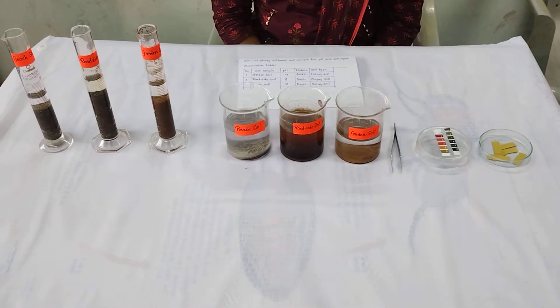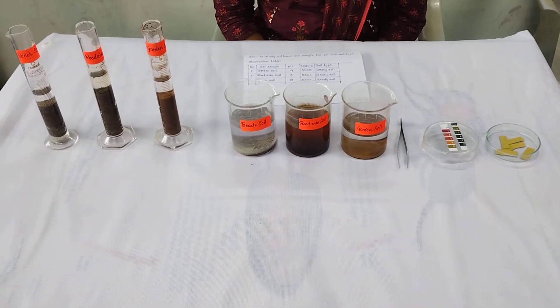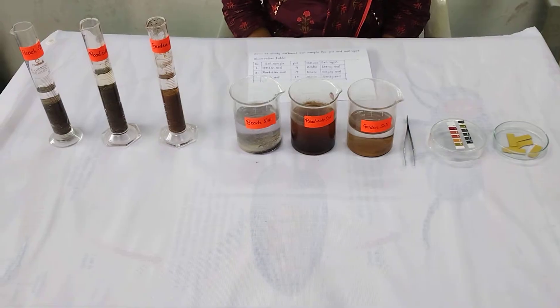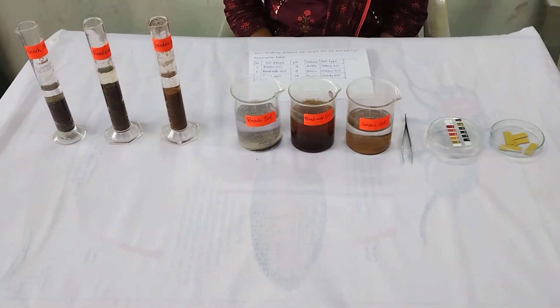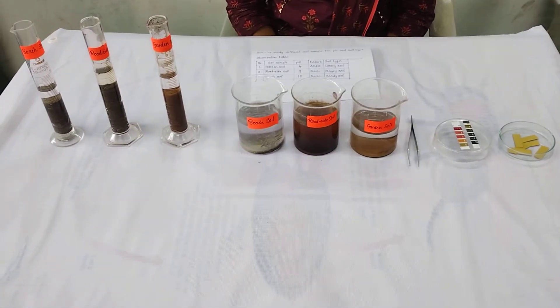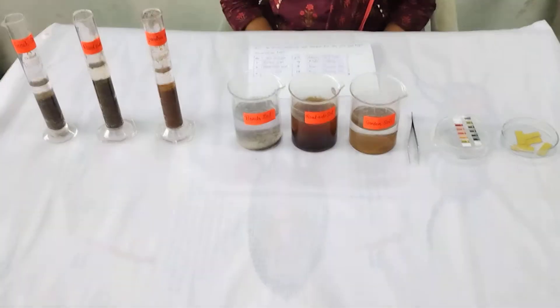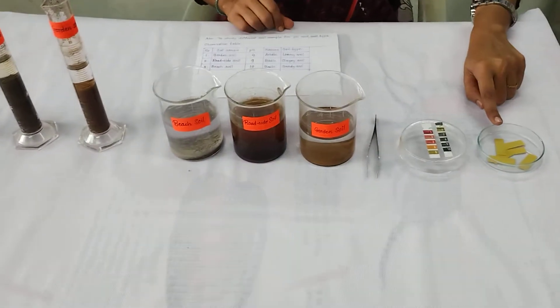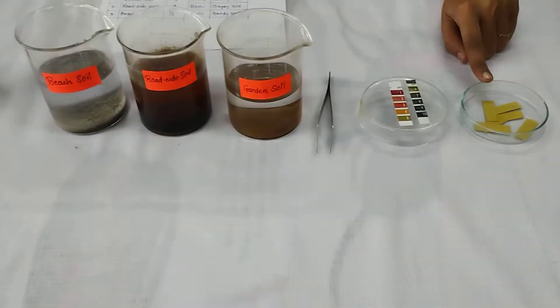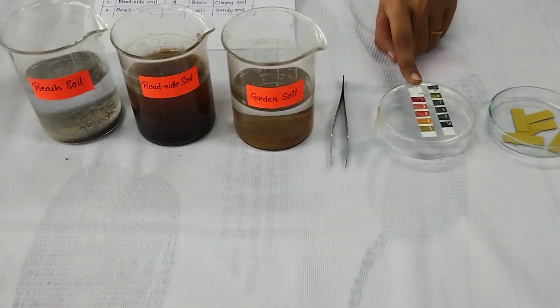HSC Board Practical, Subject Biology, Question No. 3: To study different soil samples for pH and soil type. Requirements are pH paper, i.e. Universal Indicator pH scale.